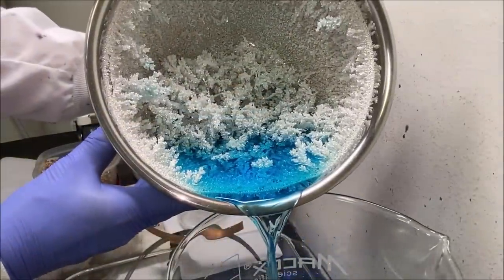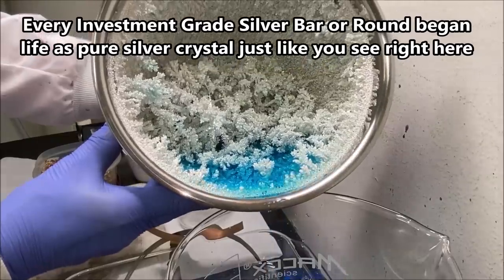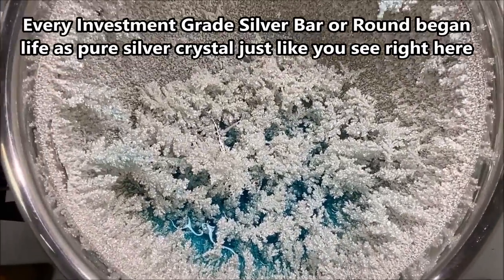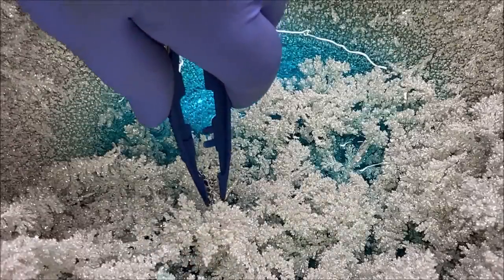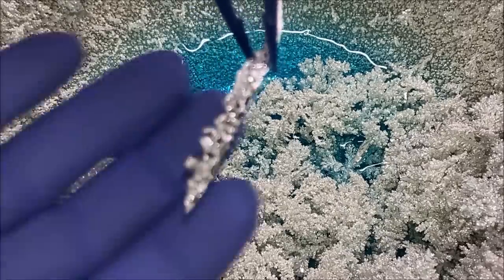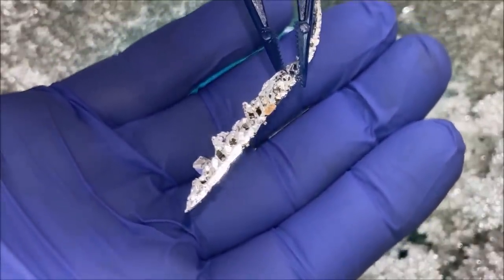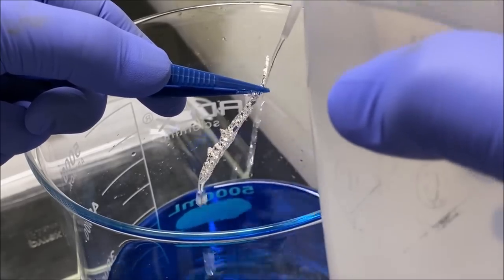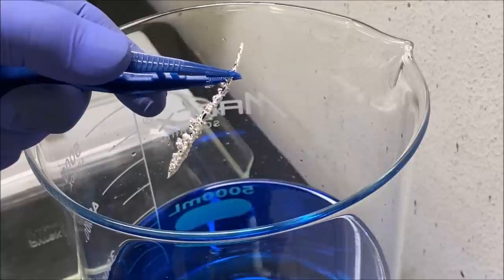Here's a look at the pure silver crystals — it actually looks like snow in there. This is really something — it's just beautiful. This is the best crystal in the whole batch, the most unusually shaped, and it is quite spectacular.